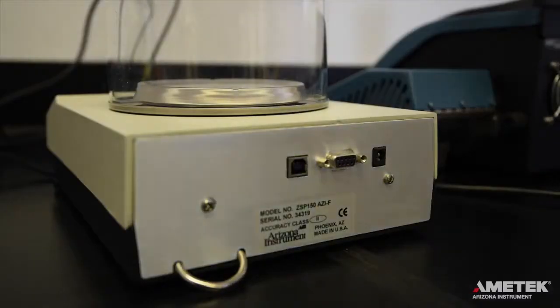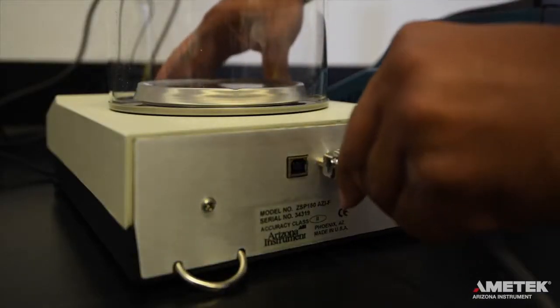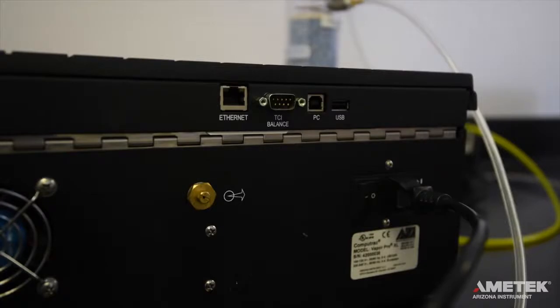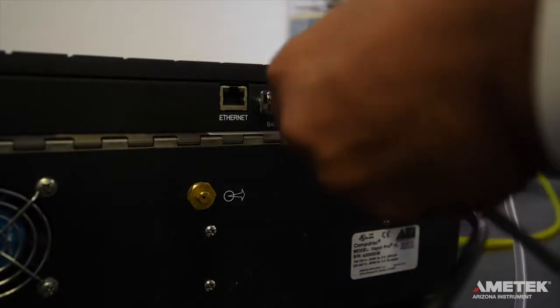To connect the VaporPro XL to the Ametek Arizona Instrument ZSP150 External Balance, use the included 9-pin serial cable to plug the balance into the port labeled TCI slash balance on the back of the instrument.